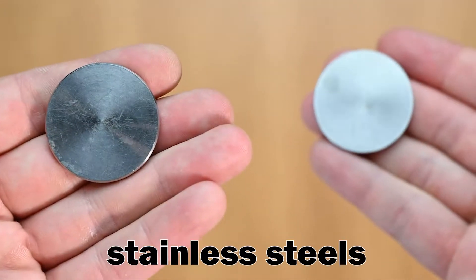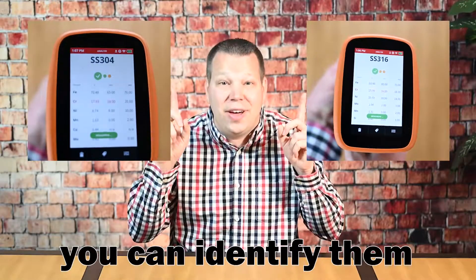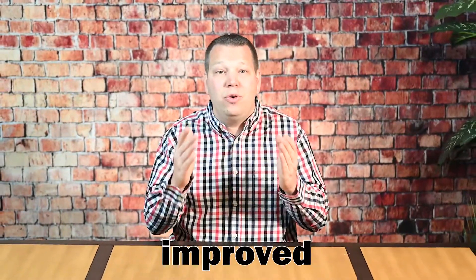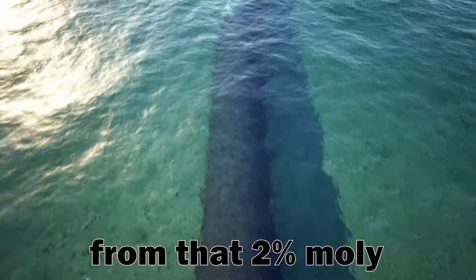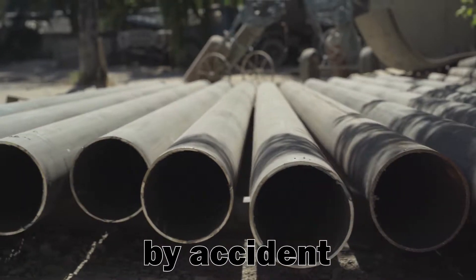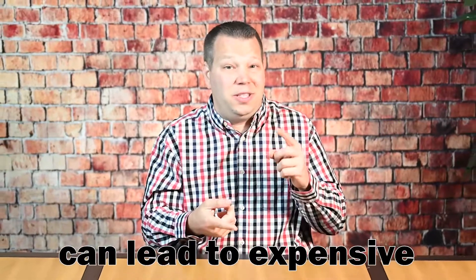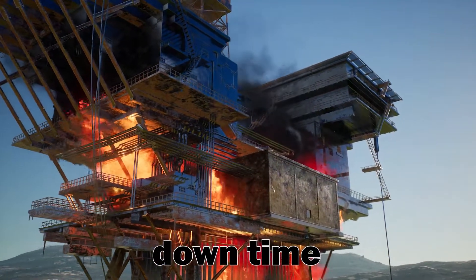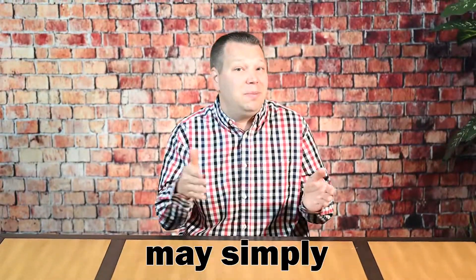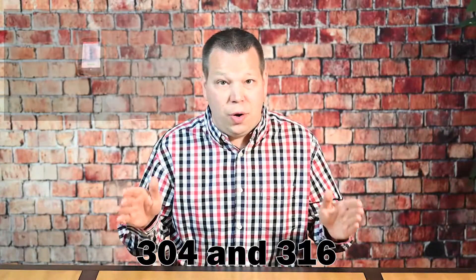Without the right technology, 304 and 316 are two austenitic stainless steels that are easy to misidentify, but with the right technology you can identify them both in seconds. 316 is typically used in applications where the improved corrosion resistance from that two percent molybdenum is required. Mixing these alloys up and using 304 by accident can cause parts to fail in the field. These failed parts can lead to expensive breakdowns, downtime, injuries, or even lawsuits. The flip side — using 316 in place of 304 — may simply increase the cost of your components.